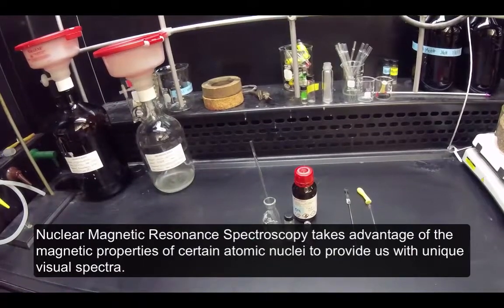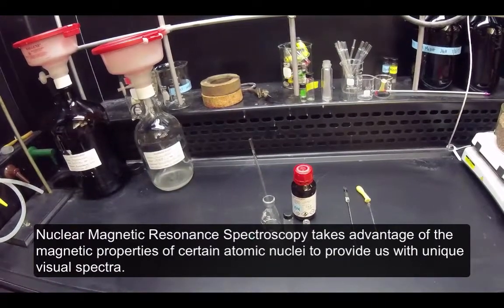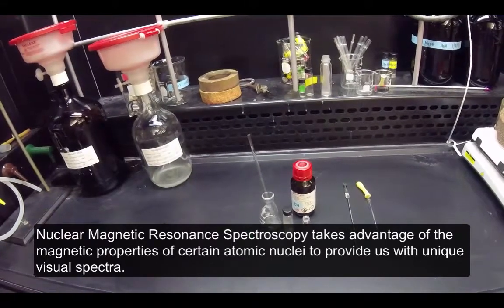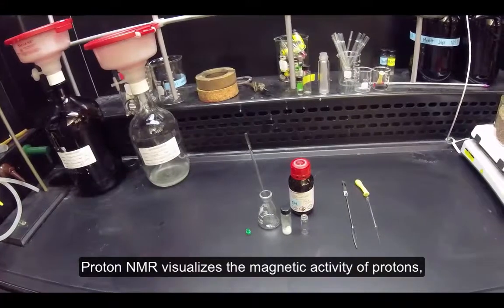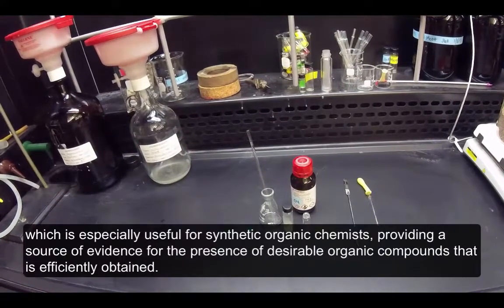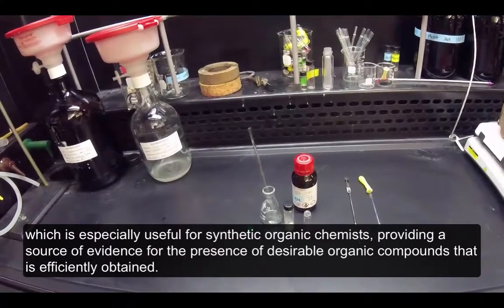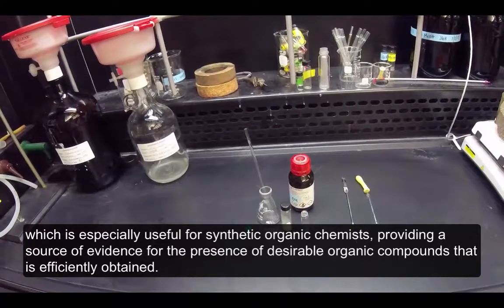Nuclear magnetic resonance spectroscopy takes advantage of the magnetic properties of certain atomic nuclei to provide us with unique visual spectra. Proton NMR visualizes the magnetic activity of protons, which is especially useful for synthetic organic chemists, providing a source of evidence for the presence of desirable organic compounds that is efficiently obtained.